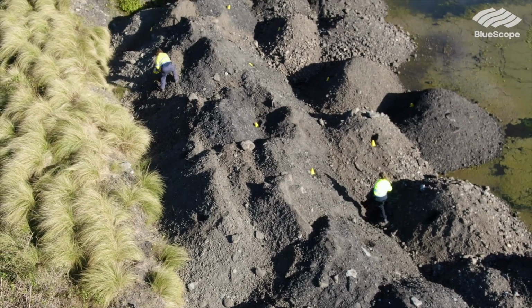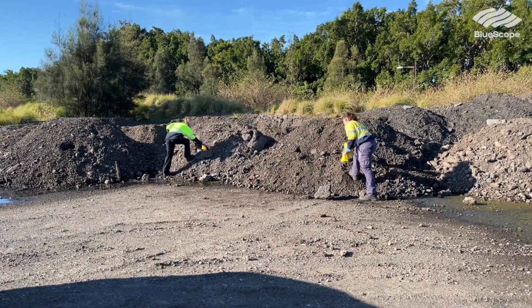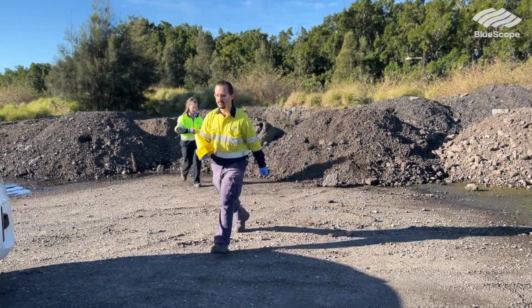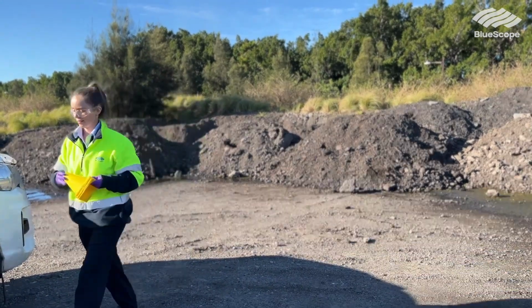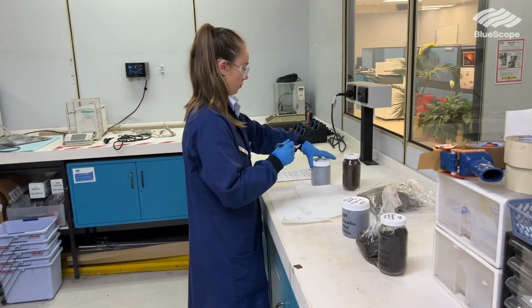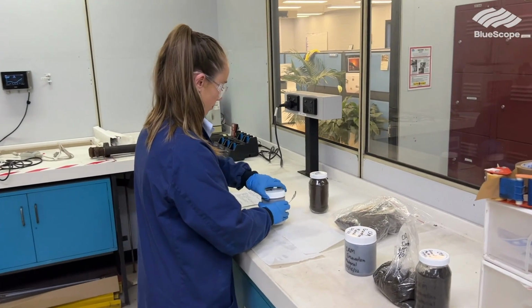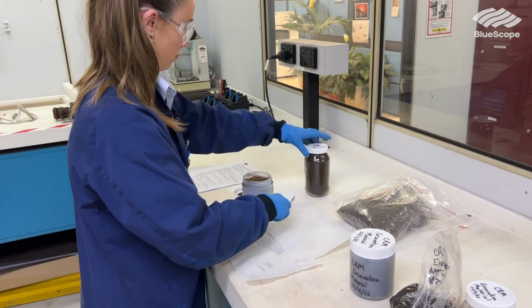It's important to take the correct samples at the correct time, because people on plant need to know what kind of processed water that they're dealing with, or in this case what waste samples they're dealing with. And it's important to know the levels of specific contaminants and analytes in those samples to make sure that they're disposed of properly. We take the samples, we send them for asbestos testing first to make sure we're not going to expose anyone to potential asbestos contamination.